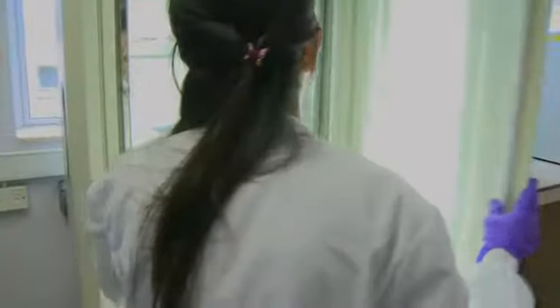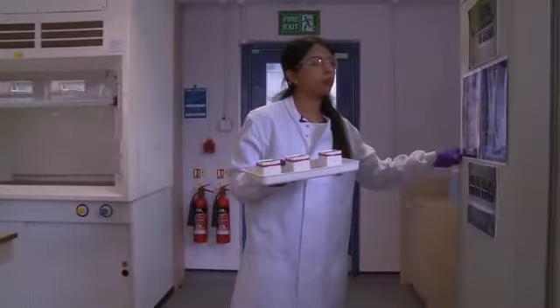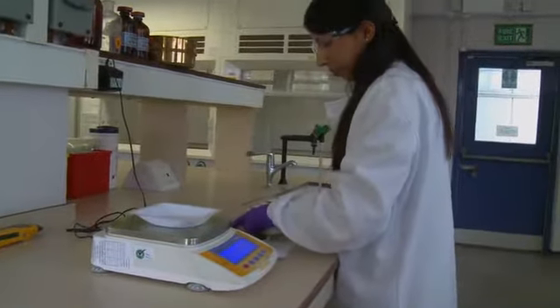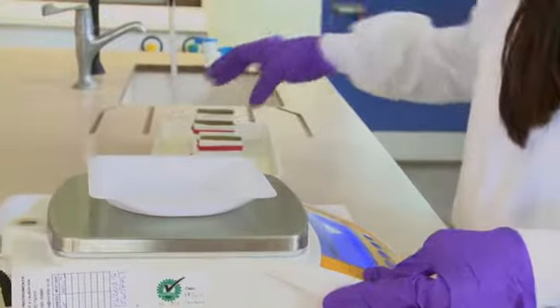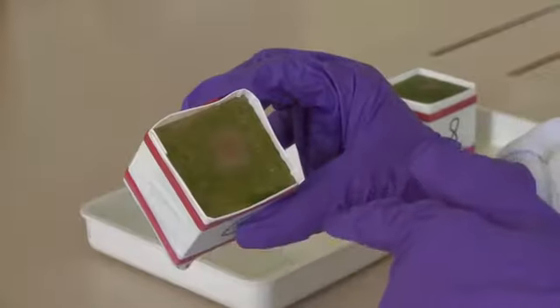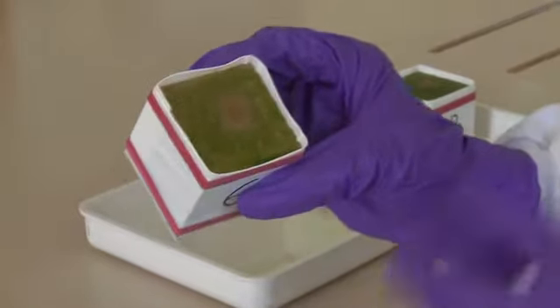Every week I've been measuring the stone bioreceptivity, so that's how the stone responds to algal growth on top of it. Over the month that the stones have been inoculated and in the growth cabinet, hardness hasn't changed very much, as we would expect. Surface colour has obviously changed quite considerably, and it's a good proxy measure of how much colonisation there is on the surface. The outer edges are more colonised with little growth in the centre, and that's a common pattern on all of the blocks.